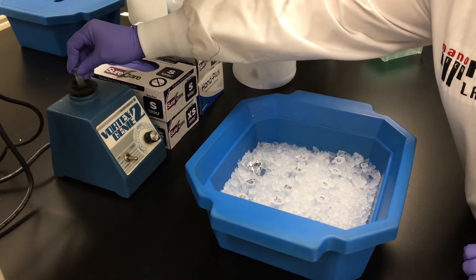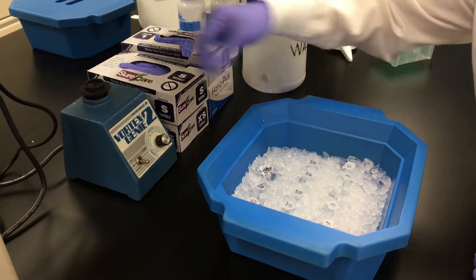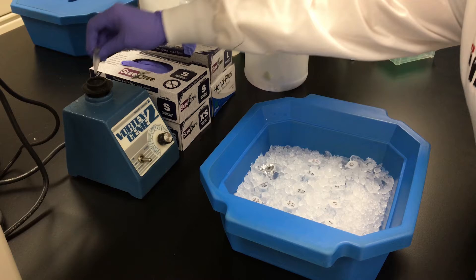Now that water, DNA template, silver nitrate solution, and buffer have been added, each sample tube is vortexed to ensure that all components of the solution are mixed thoroughly.